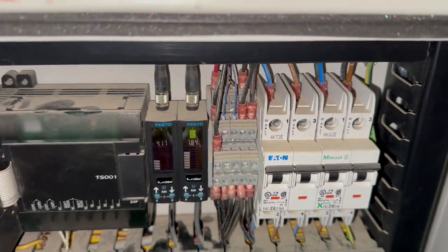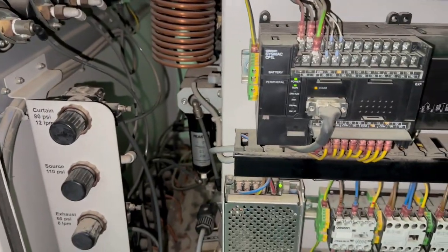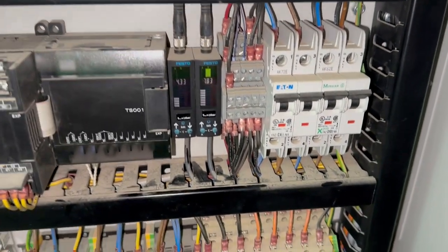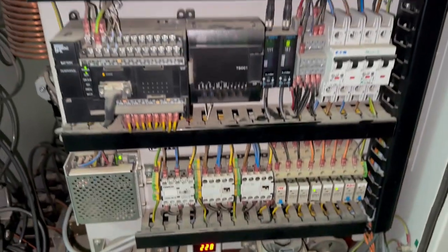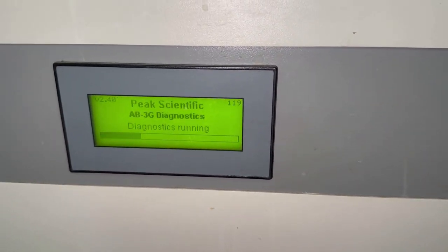Since this is the diagnostic mode, maybe there is some sort of diagnostic through the software. So first observe all those things, and then let's see what happens. Over the screen, diagnostic running.